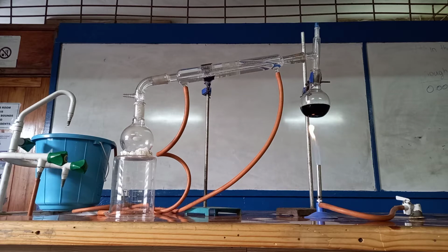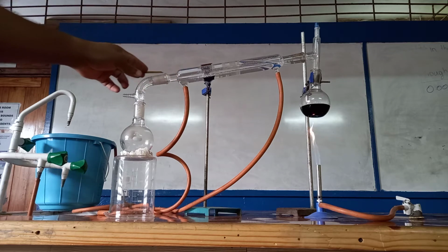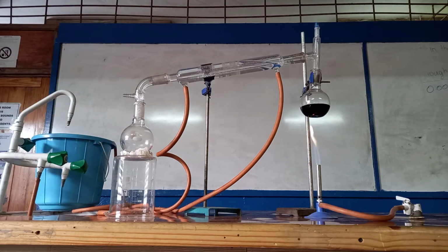So what is going to happen is that when the mixture is heated, the aldehyde is very volatile, so it will vaporize quickly. And so, as you know, this apparatus is a distillation one. So our aldehyde is going to run down in the tube and we're going to collect it. Alright, and then we're going to do reflux and oxidize our aldehyde to a carboxylic acid.